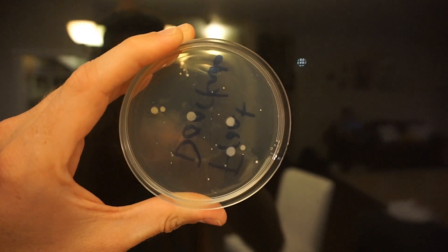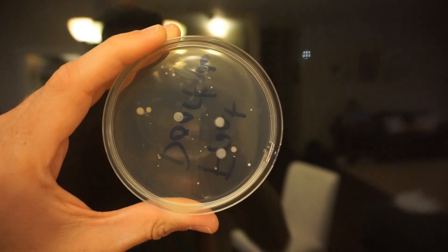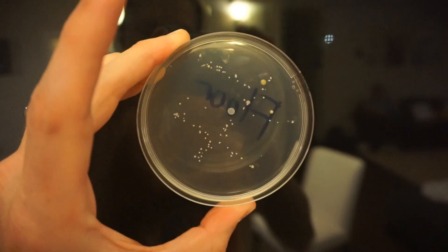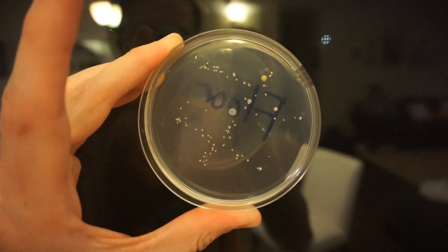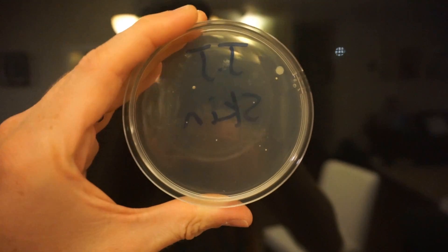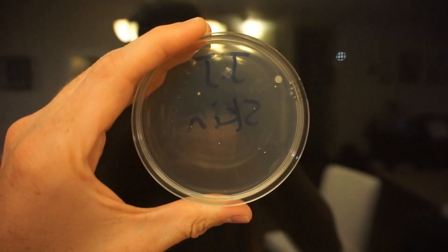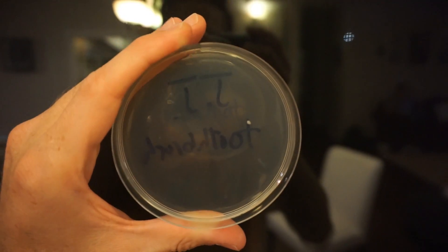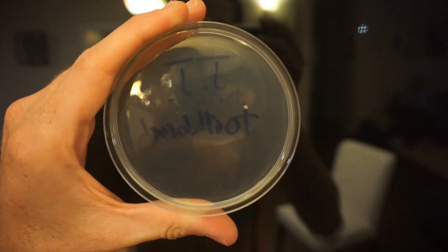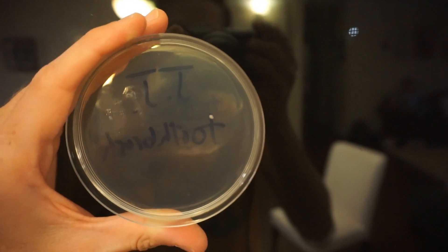Here's the doorknob — this one's not too bad. Some big colonies in the middle, some small ones, not a lot overall. The floor has a good amount of colonies, but not growing very fast. This is a little surprising: my skin — armpit and belly button — has only a few colonies, very clean compared to the rest. And the winner for the cleanest out of all of them is my toothbrush. It hadn't had any colonies up till now — there's one colony after 72 hours. So your toothbrush is the cleanest thing in your house based on my experiment.